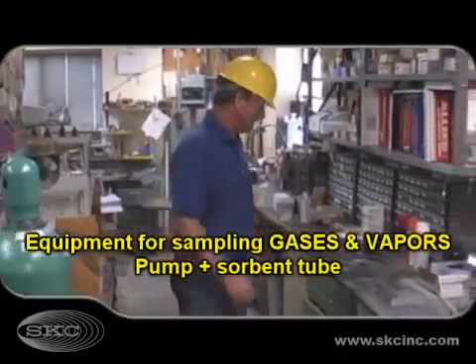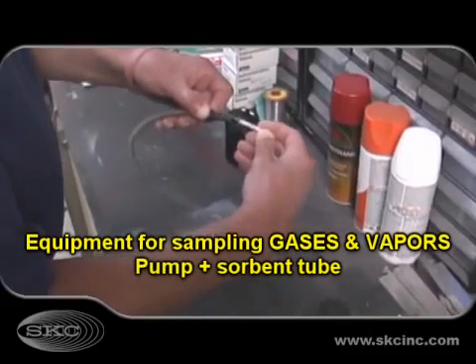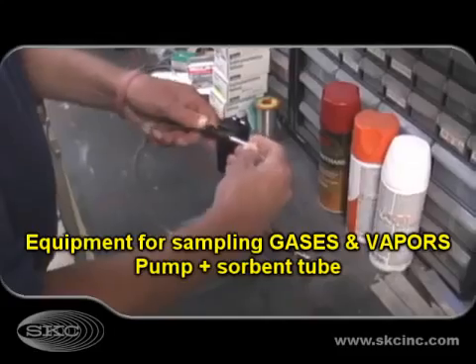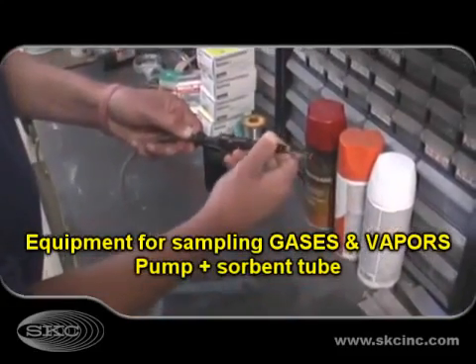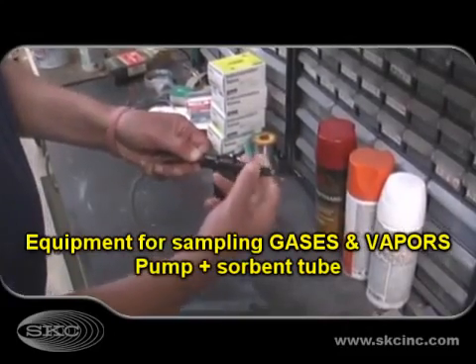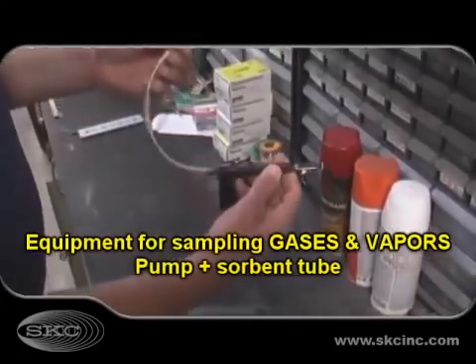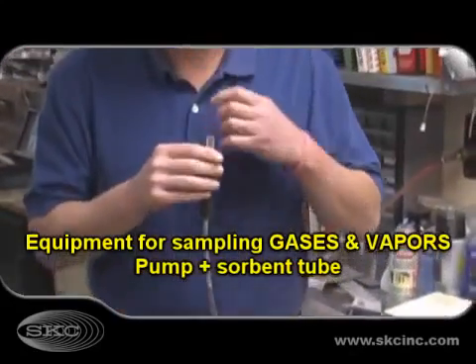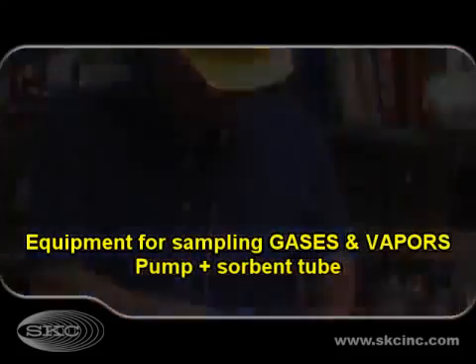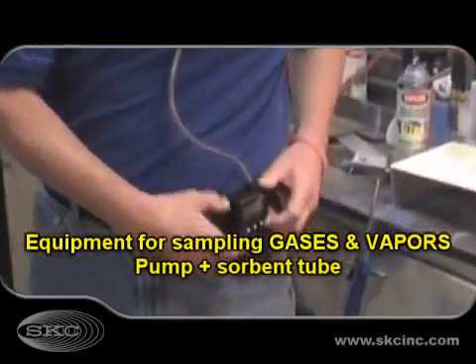To sample gases and vapors, sorbent tubes are the typical sample media. The glass sorbent tube is prepared and inserted into a holder. A protective cover is installed to prevent the tube from breaking. The holder can be clipped in the worker's breathing zone. The sample media is then attached using connecting tubing to a pump that has been calibrated to the recommended flow rate.